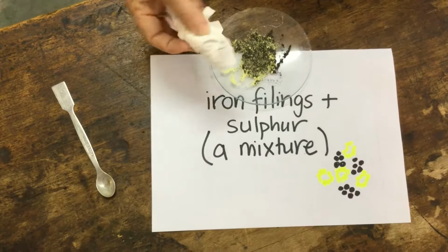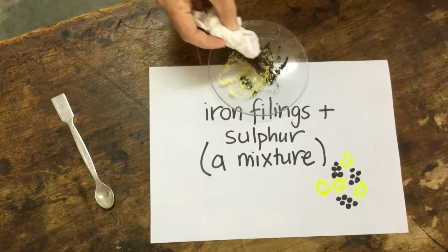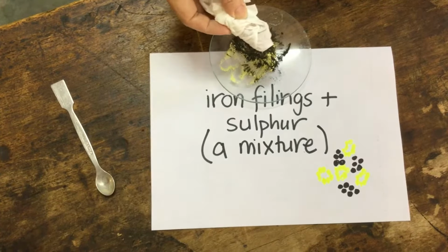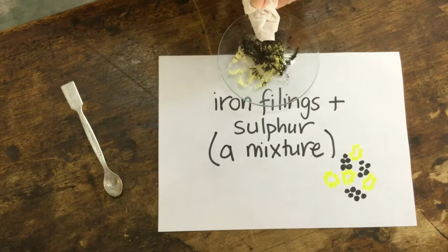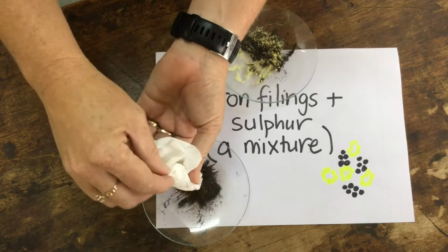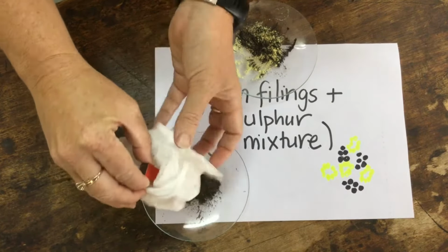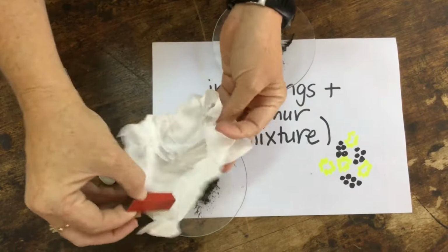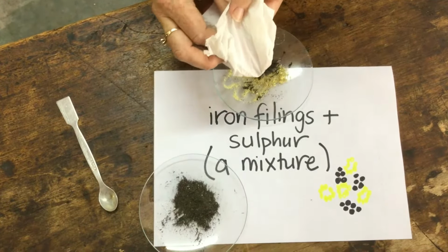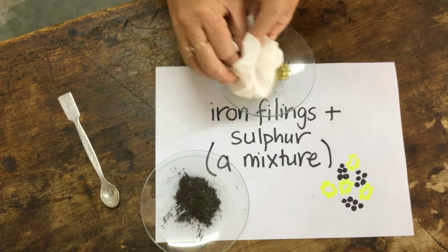If I bring my magnet, again wrapped up in my tissue, nearby, you can see that I can separate out these iron filings. I can separate out the iron filings, just get the magnet out, drop them there, and separate some more iron filings, clean them off, drop them there, and separate some more.